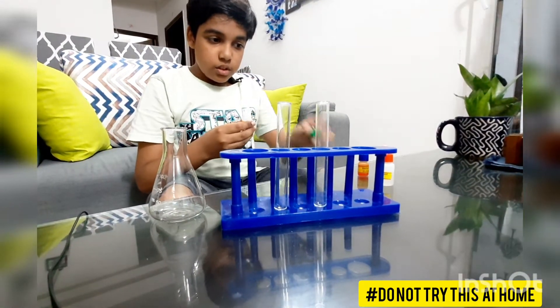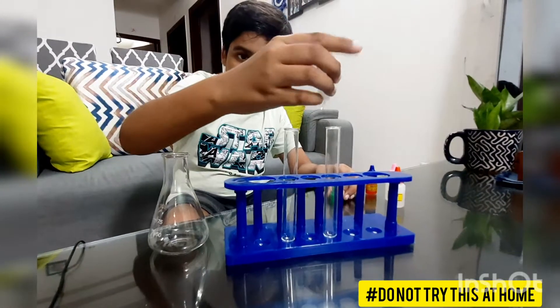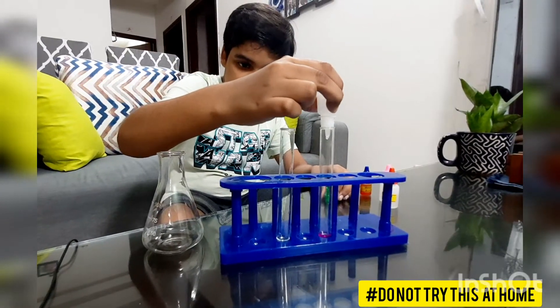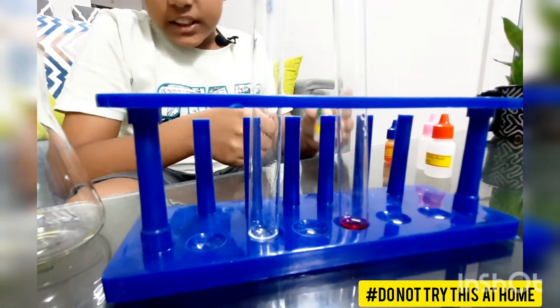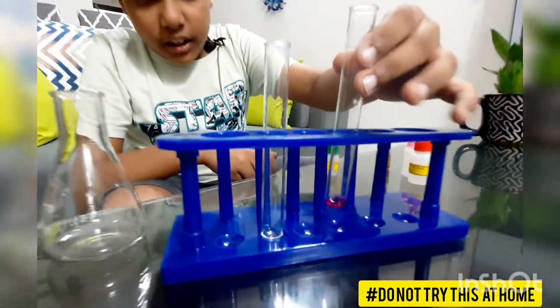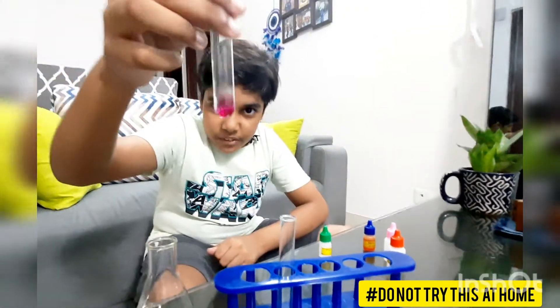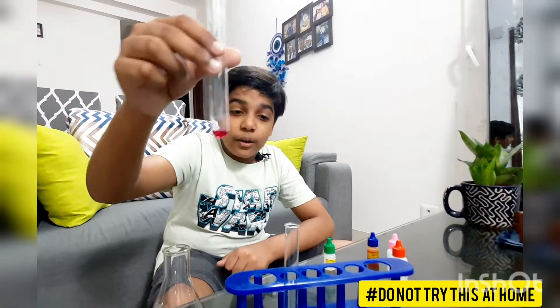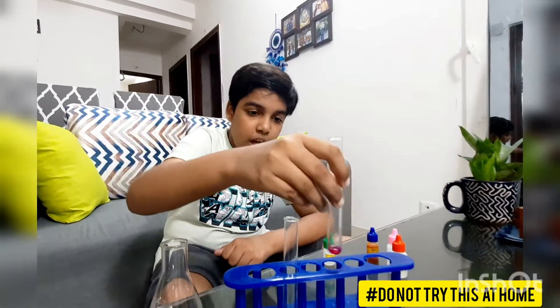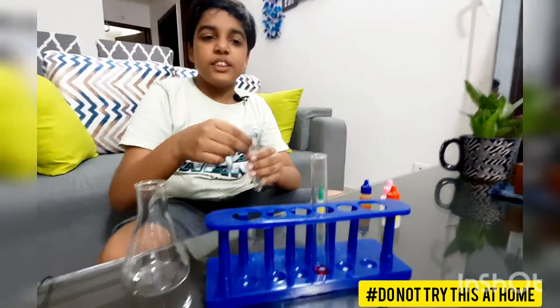Now the other solution might be basic in nature. As we see, it changes to pink color. Let me show you in a little more detail — see, it changes to pink color.